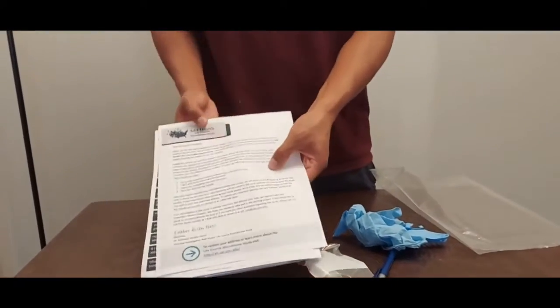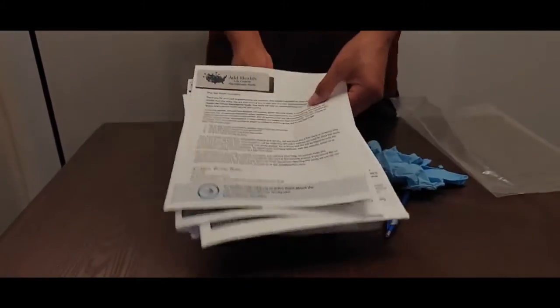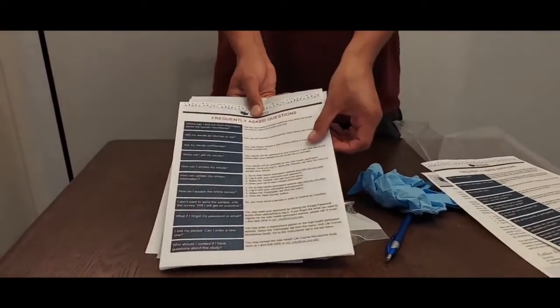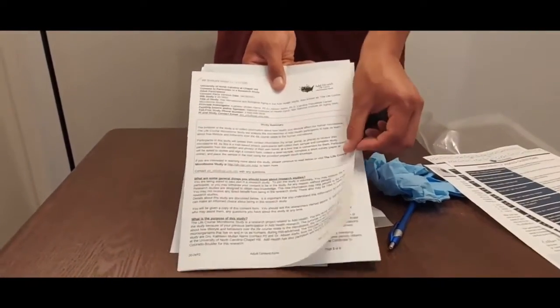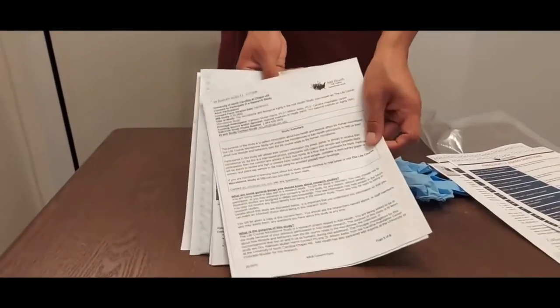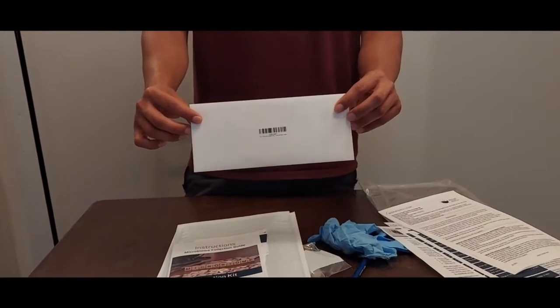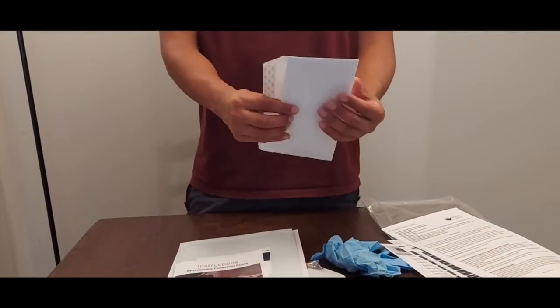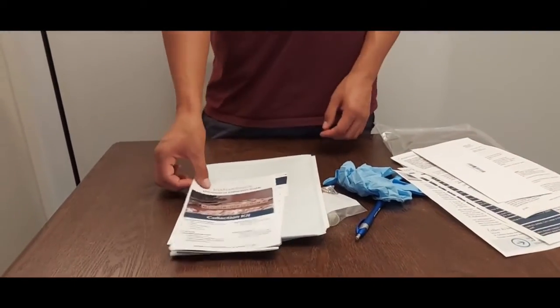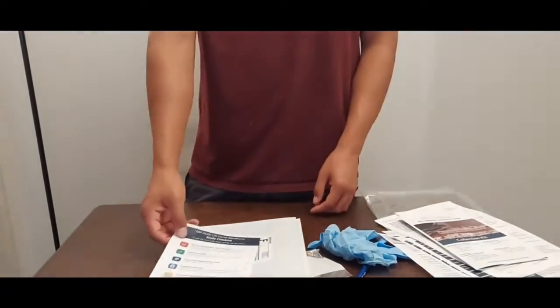a greeting letter by the AdHealth Microbiome Principal Investigator, frequently asked questions and contact information, a copy of the full consent form. You can also download an electronic copy for your records on the AdHealth participant website, a regular-sized envelope with the consent form signature page, written instructions on how to collect your samples. A separate video also describes this.